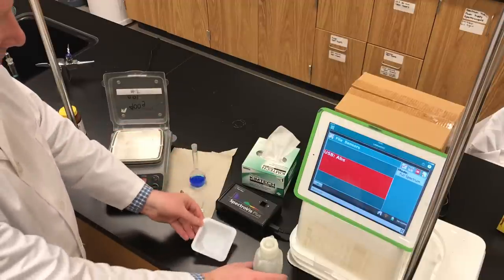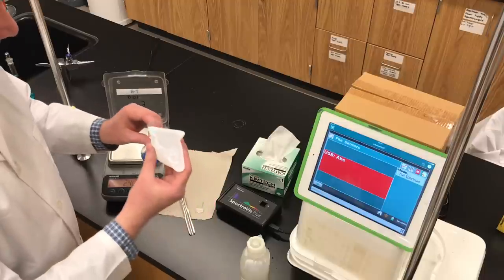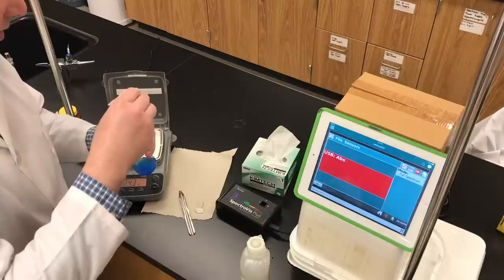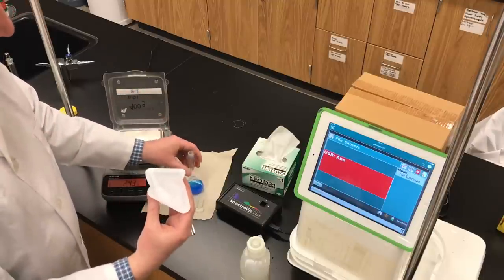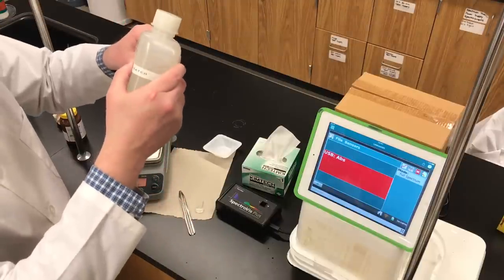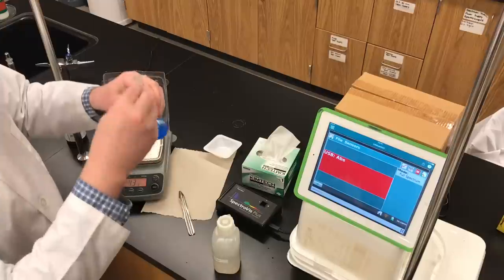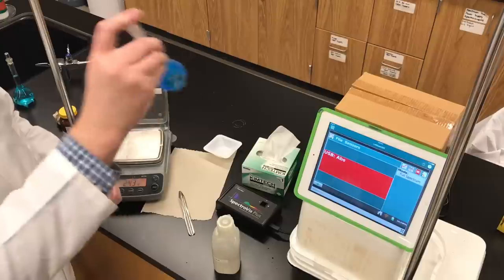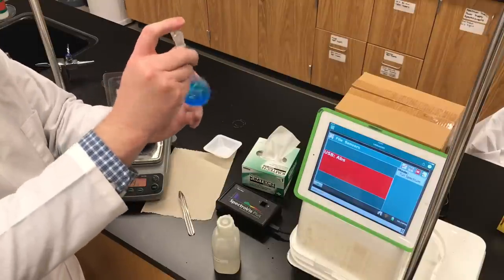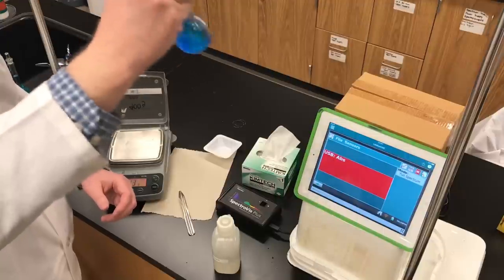There's a little bit of blue still left in the weighing boat — one tiny spot — which I'll ignore as a small source of error. I'm going to continue adding distilled water until the flask is approximately one-third to one-half full, and wash down the neck of the flask to make sure there's no solute there. We'll stopper it and shake in a circular motion — avoiding getting solution up into the neck — until it's completely dissolved.